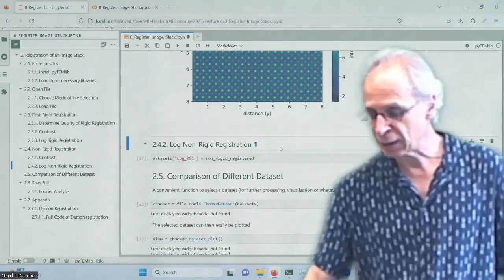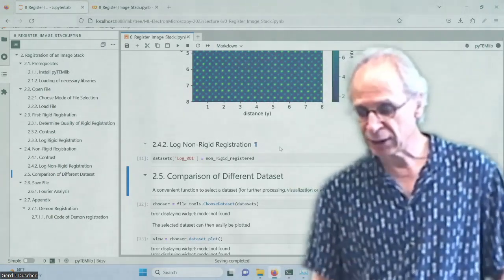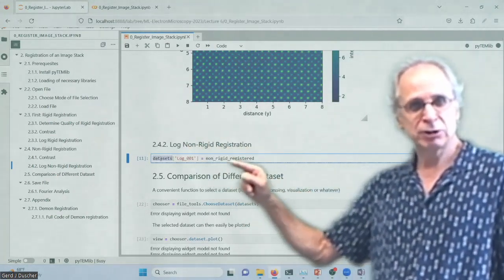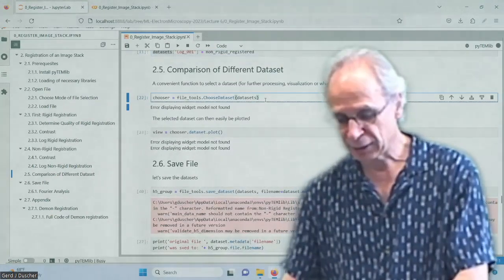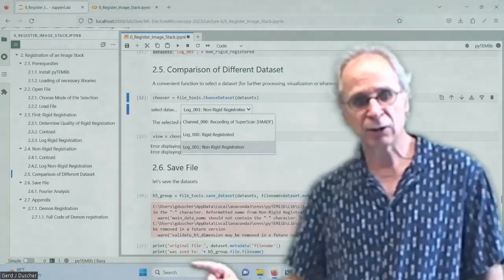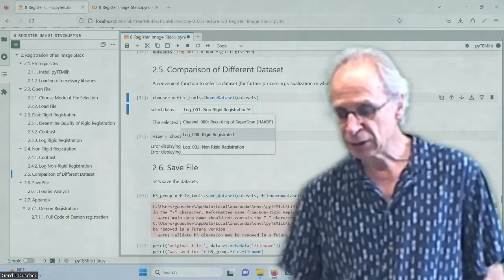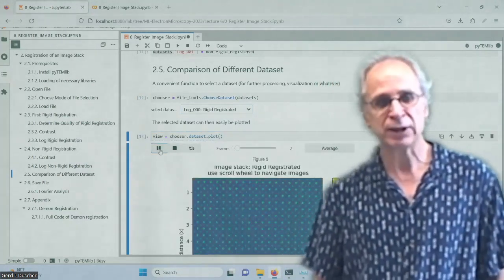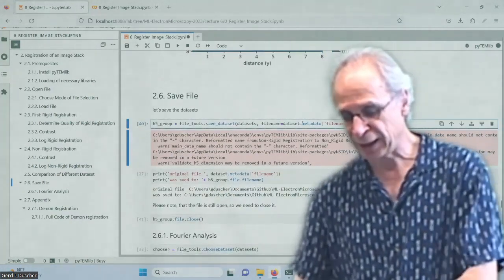And then we can log that. So we have our data sets. That is just a dictionary. So we put another one on here. And so now we have dataset chooser. We can go for any of the ones we have and can look at them again if we want to. So that was the rigid registrated ones. And so we can just view them as we want. And we can save that file.